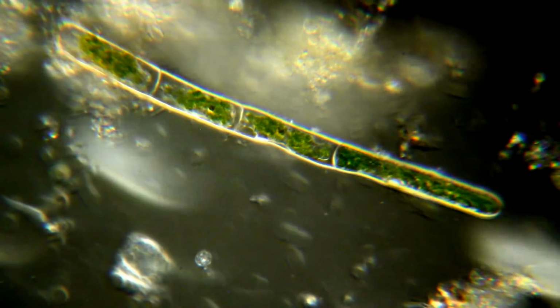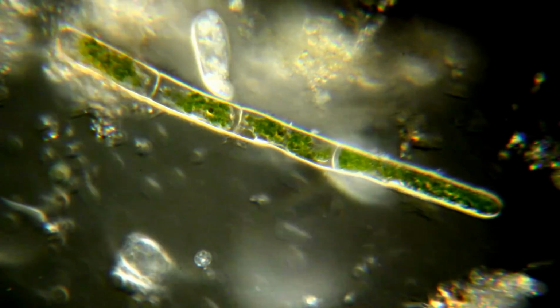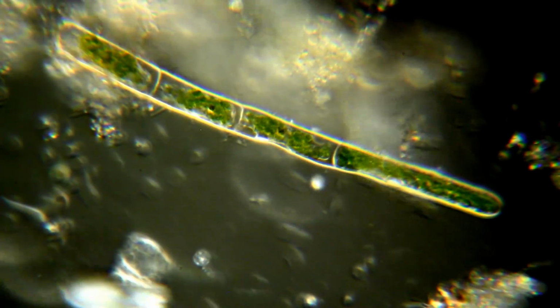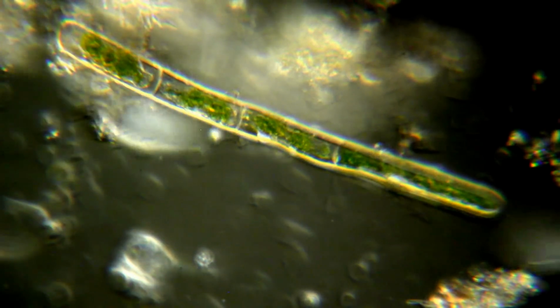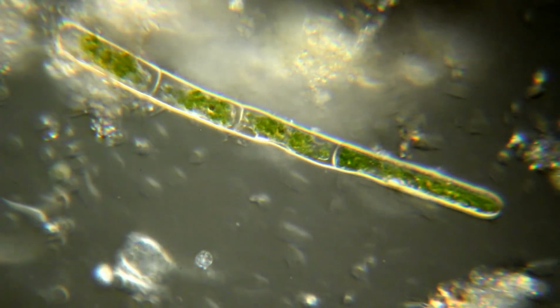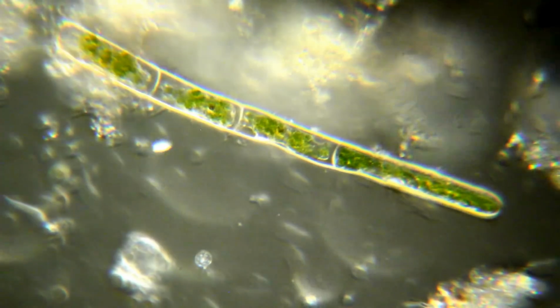So I unscrewed the condenser lens almost all the way out, and it's just basically sitting there. And so far at the dark field position on the turret, this is about as good as I've been able to get. As soon as I can get maybe something modified here, I can get a better dark field.